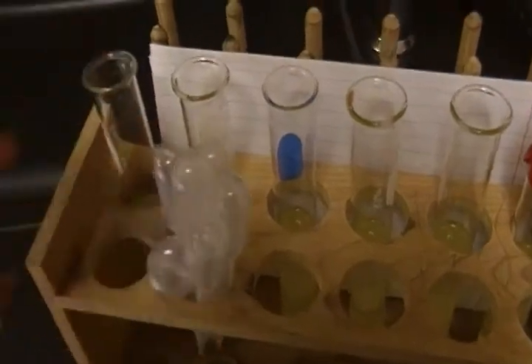You can see that I have 2 drops for each test tube. So there's 1 here and here for test tube 1, here and here for test tube 2, and so on. Be absolutely certain that you use a new, clean, disposable pipette for each time in each new test tube, or you can mess things up. To one side, we're going to add lead nitrate. To the other side, we're going to add potassium iodide.